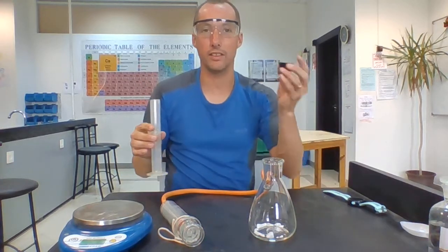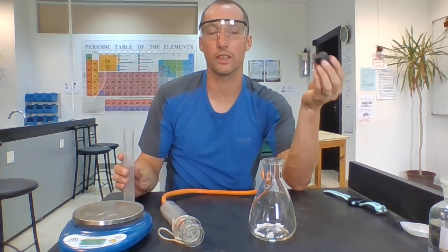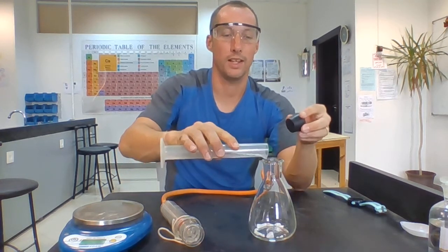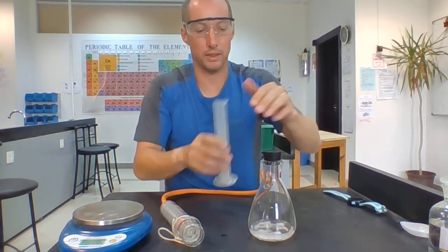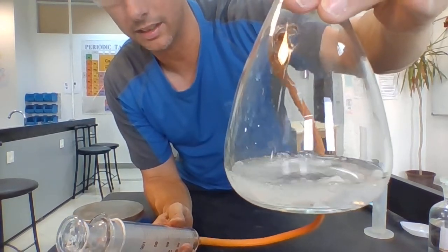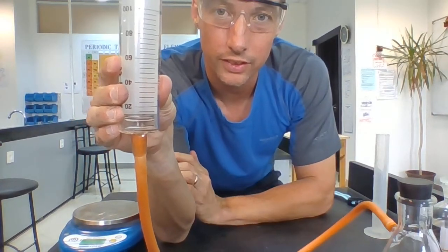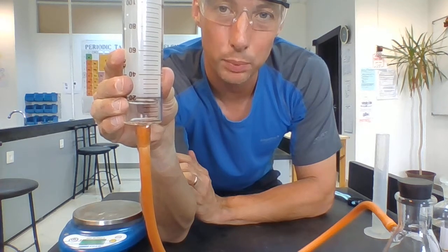As soon as I add it in, I need to get this top on, because if I don't, a lot of the carbon dioxide is going to escape in the first few seconds. So I add it. I can already see, I don't know if you can see the bubbling from where you are, on here. So we're definitely getting a gas produced, and that gas is carbon dioxide. I look at my gas syringe, it's no longer on 0. And can you see that the gas syringe is getting pushed up and up?